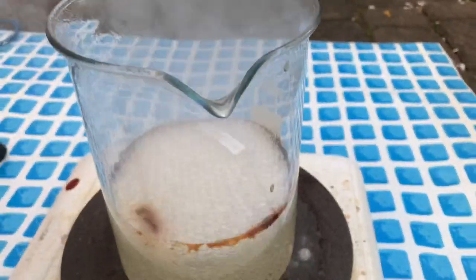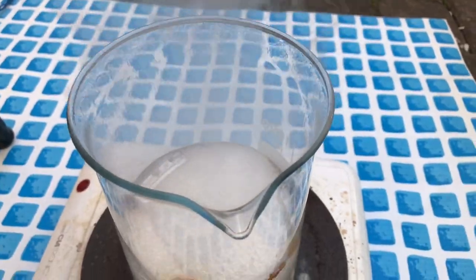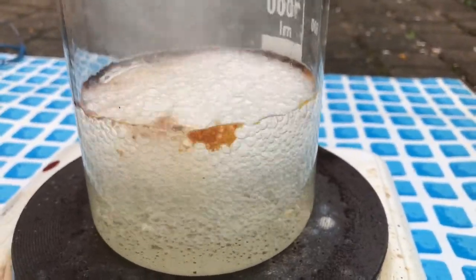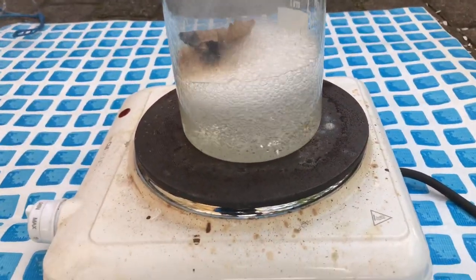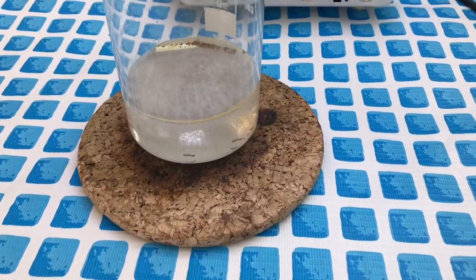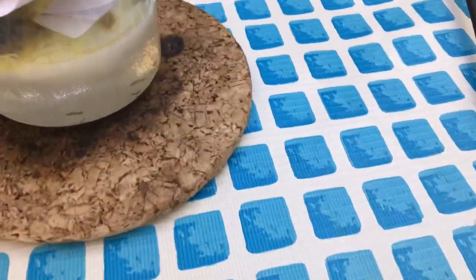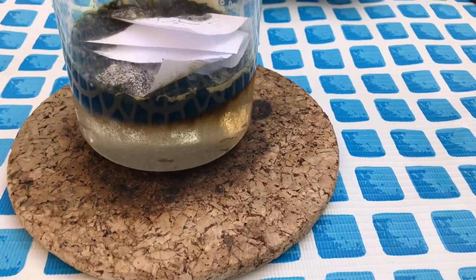Does it decompose? No — only the paper from the back side of the plastic, where some residue is starting to decompose. The walnut has turned into goo and there's nothing left. Let me throw in that leaf I just found. It's starting to bubble violently and the leaf also starts to dissolve. After a while there was nearly nothing left in the beaker and it was still fizzing profusely, so we're just going to throw in some more paper.